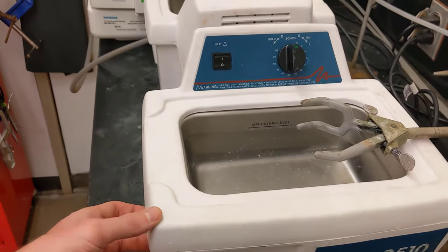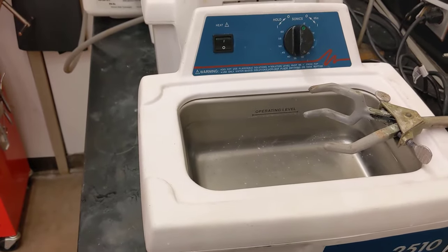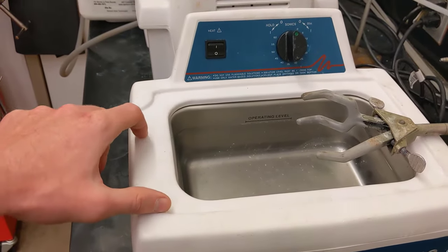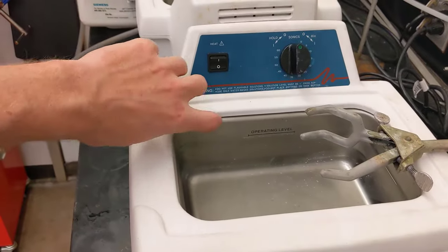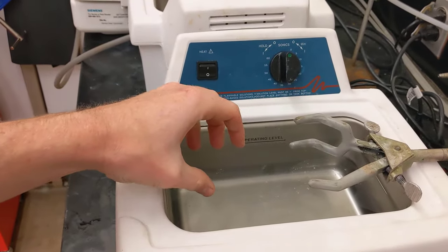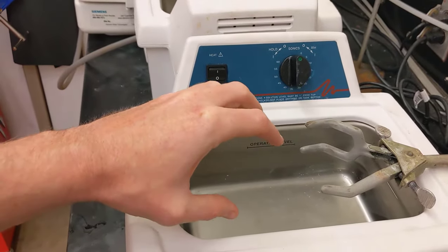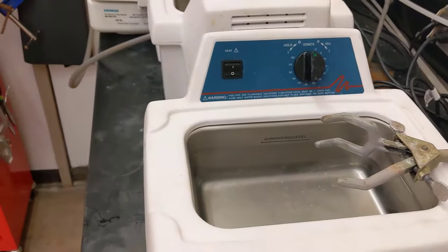The bath is pretty simple. It has an oscillator inside that generates an ultrasonic frequency, which gets transduced to this actual metal container and then into the water. If you turn this thing on, you'll see vibration inside of here and you'll actually hear the high frequency.